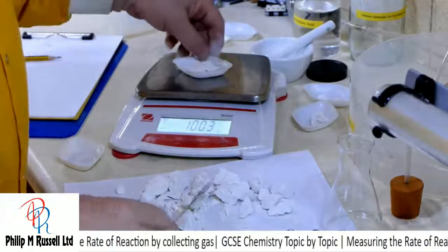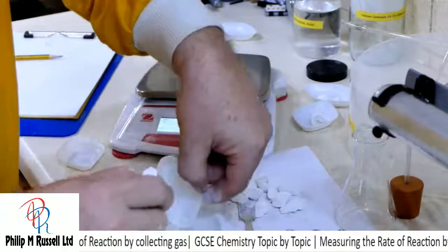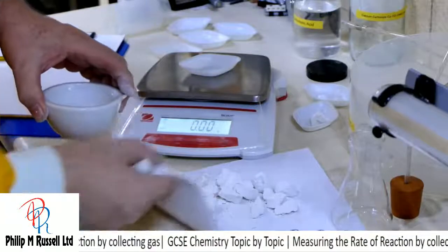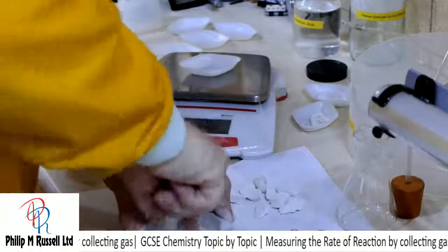What's that? Oh, 10 grams, easy enough. We'll now just break this up and make it a little bit finer. Don't really want all this other stuff here, but we'll see what we can do.